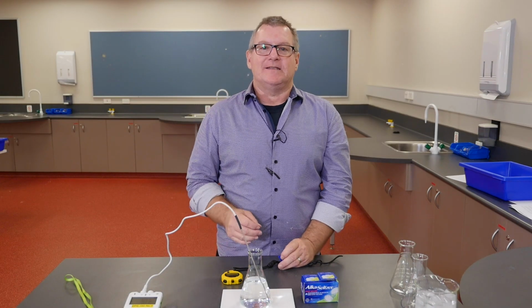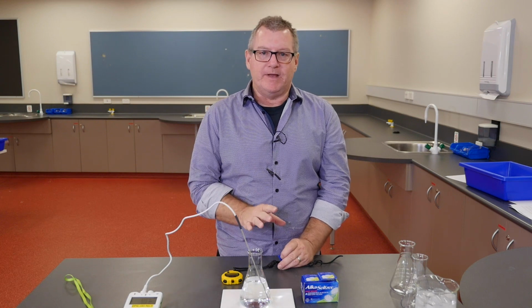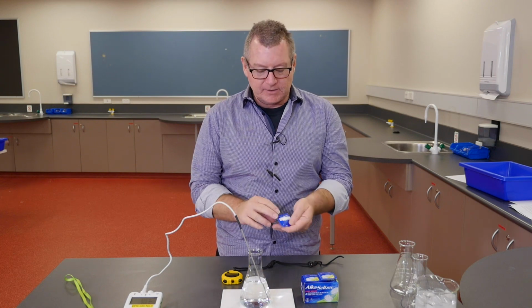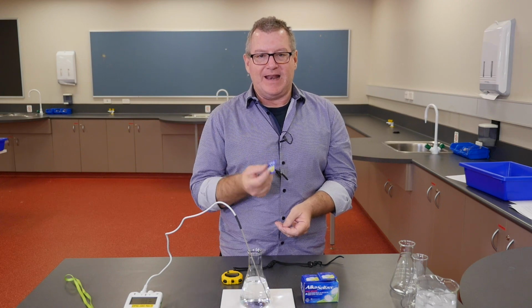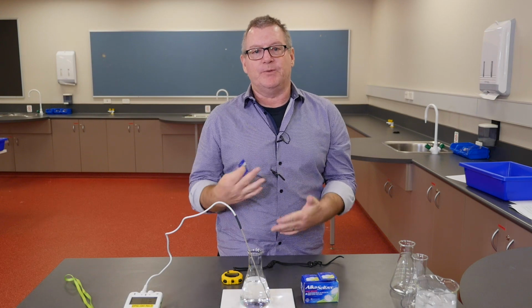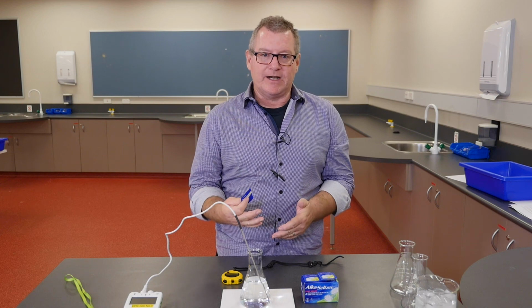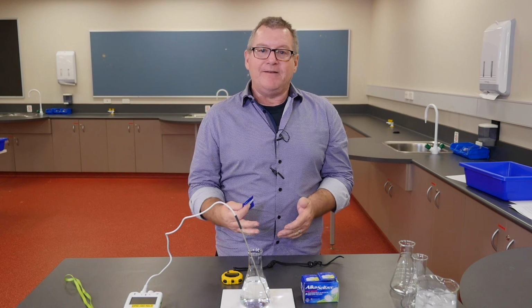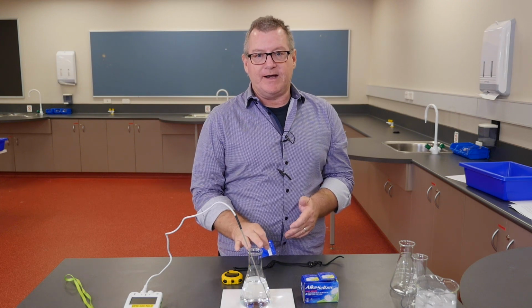There are a number of different factors that influence the rate of reaction. One is temperature, and that's the one we're going to measure today. We're using Alka-Seltzer tablets. They're basically effervescent tablets. They have an acid and a carbonate in them, and when you dissolve them in water, they undergo a reaction that produces carbon dioxide. And the rate of that reaction is what we're actually influencing. We're going to influence it using temperature, which is one of the things that influences rate of reaction.